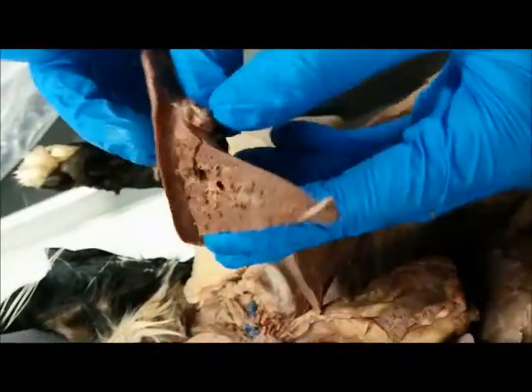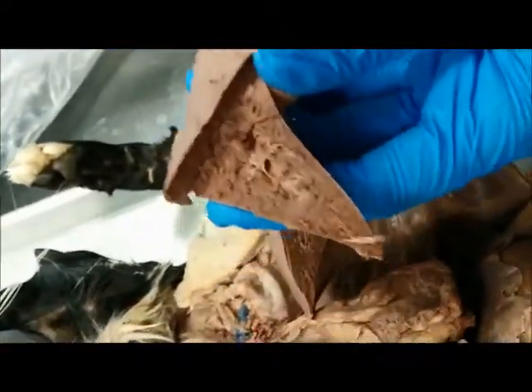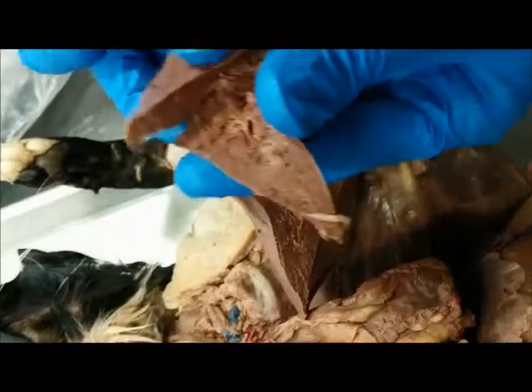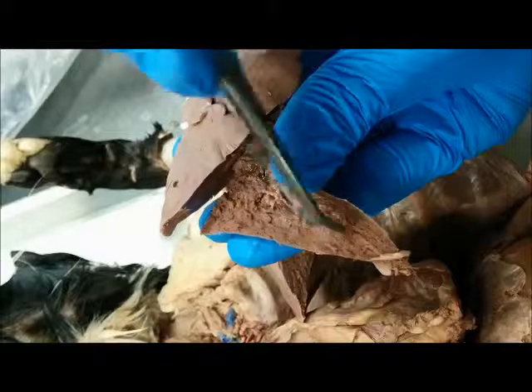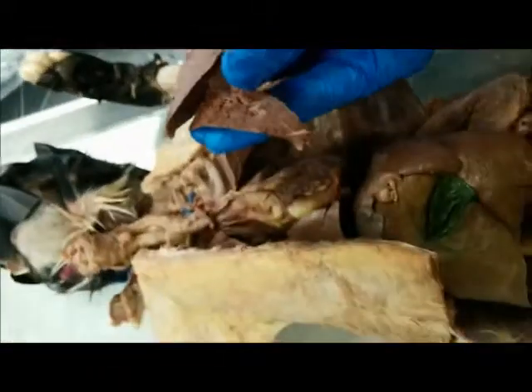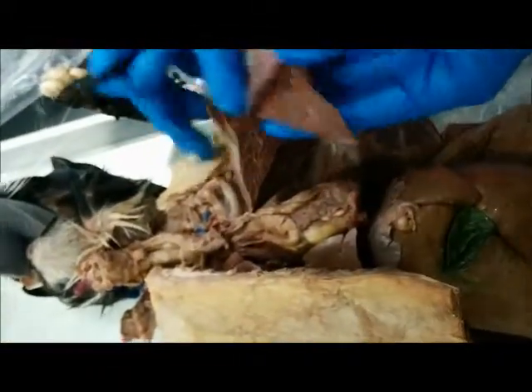And now we also have alveoli, and you're not going to be able to see them because they are microscopic, but we want to mention that when you squeeze here, you can see it looks spongy, and there are millions and millions of alveoli here, microscopic again. So that's that for the lungs.